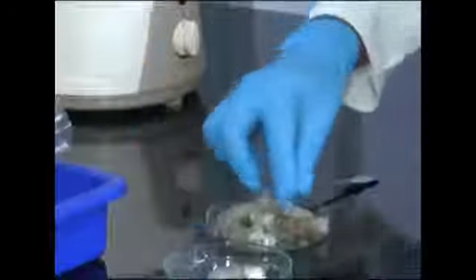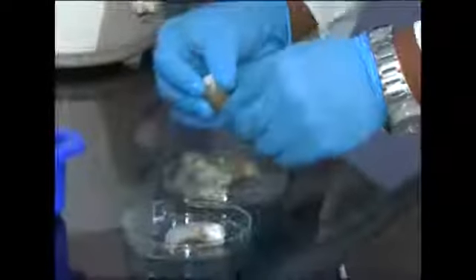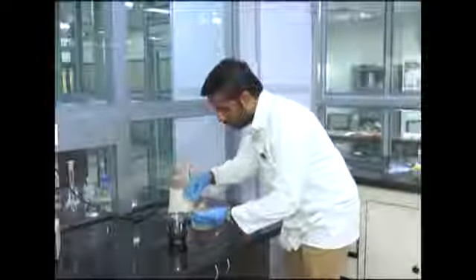The representative sample received is taken for homogenization. Only the edible part is considered. Non-edible parts, like shells in the case of shrimps, are removed. The whole sample is homogenized so that the sample is representative of the whole lot.